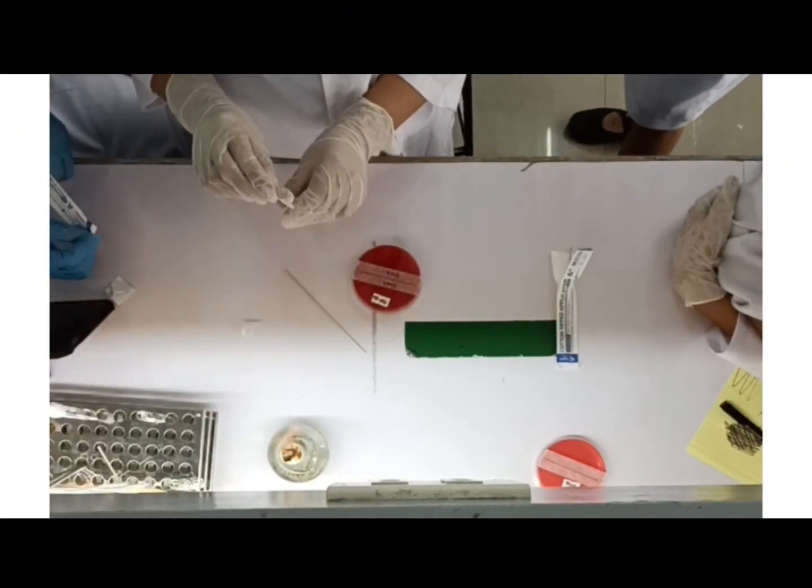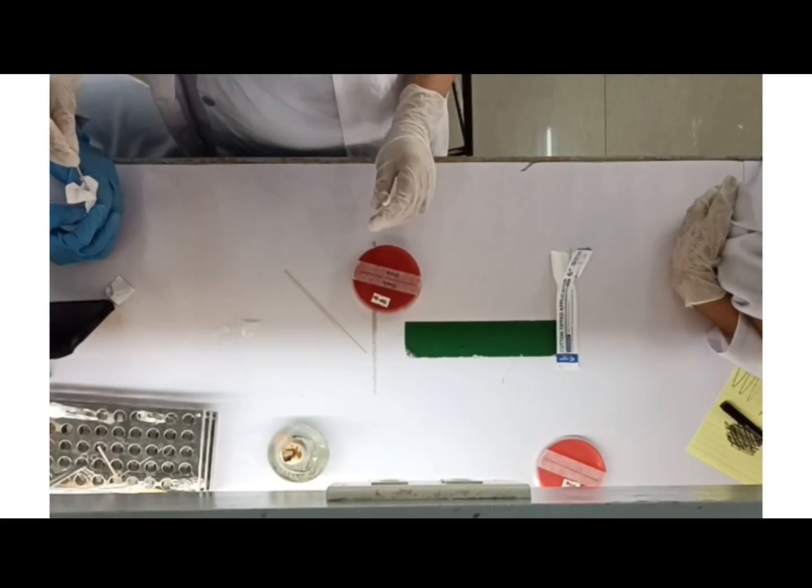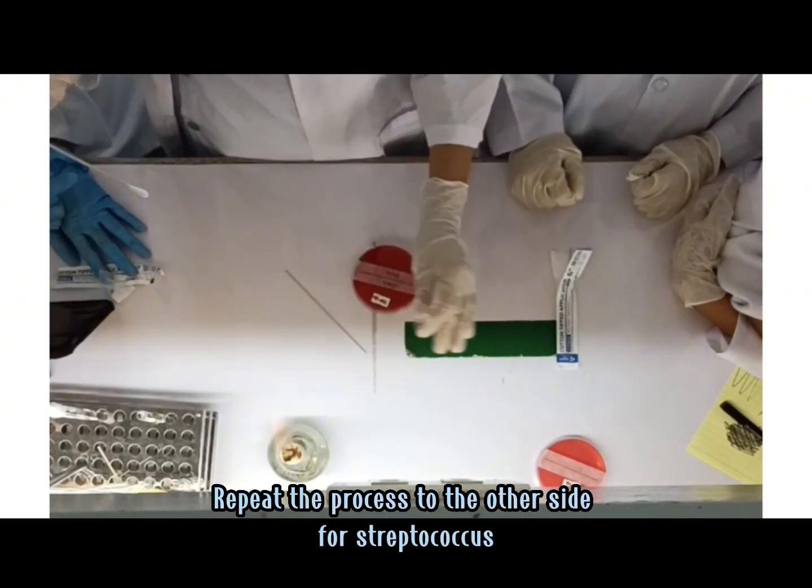After we finish streaking, since we used a cotton swab, we would now discard it and get another one for streaking of Streptococcus on the other half of the BAP and just repeat the process.